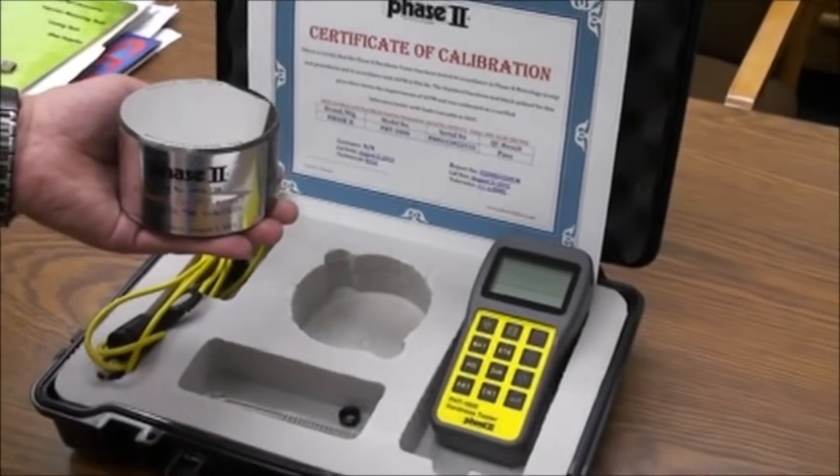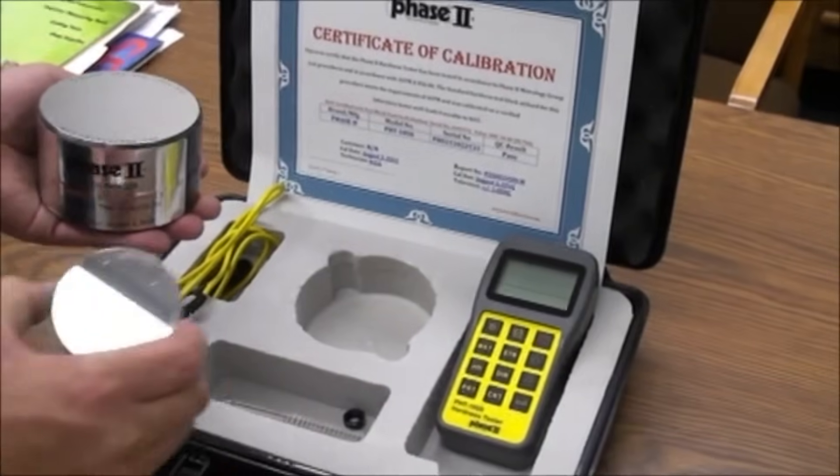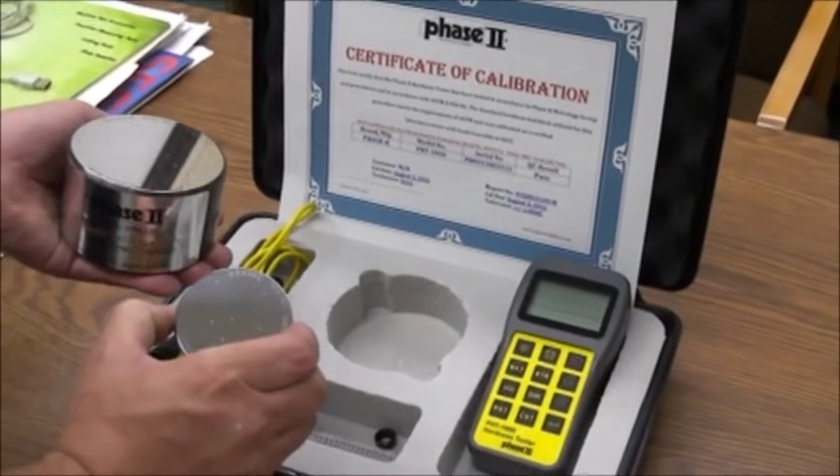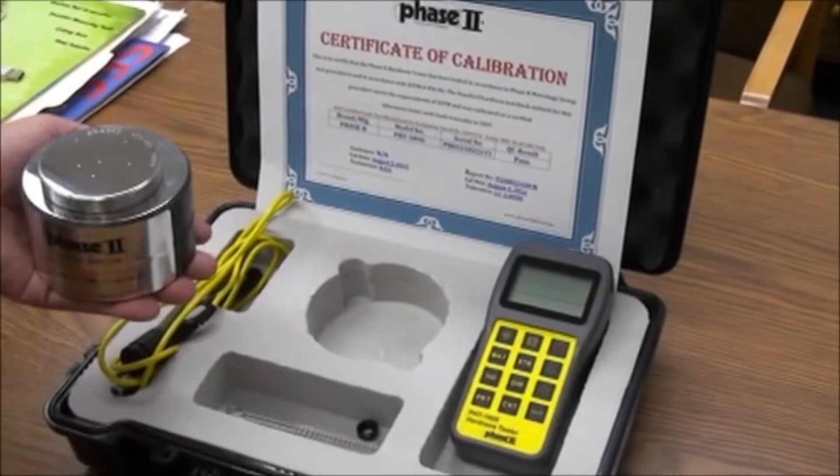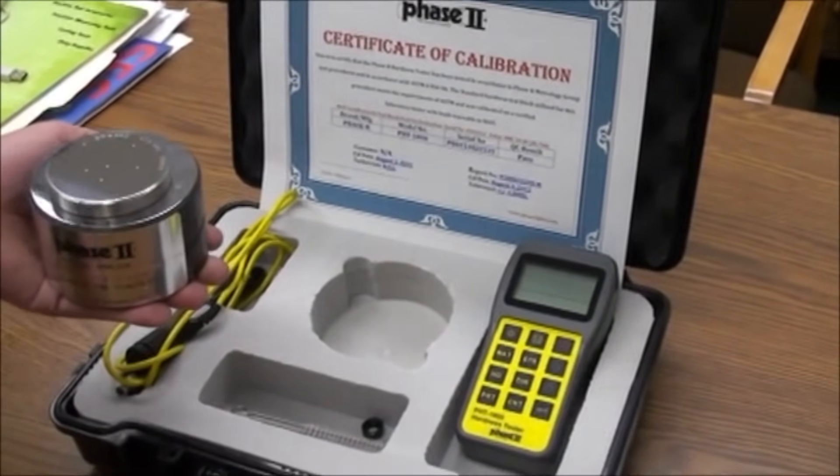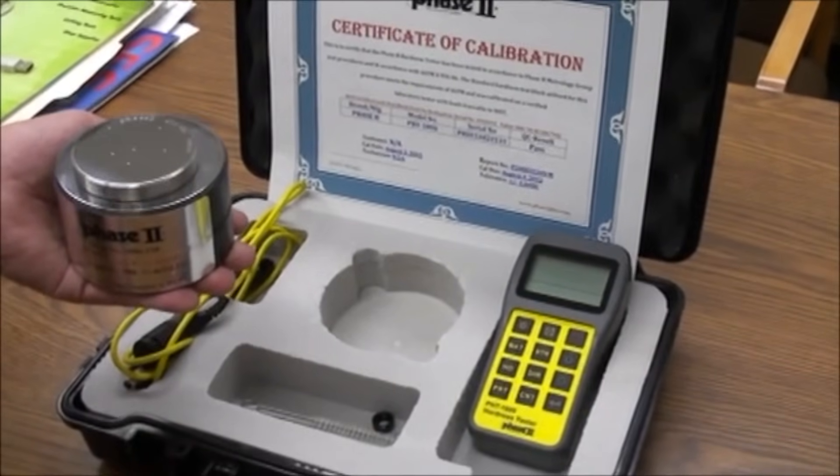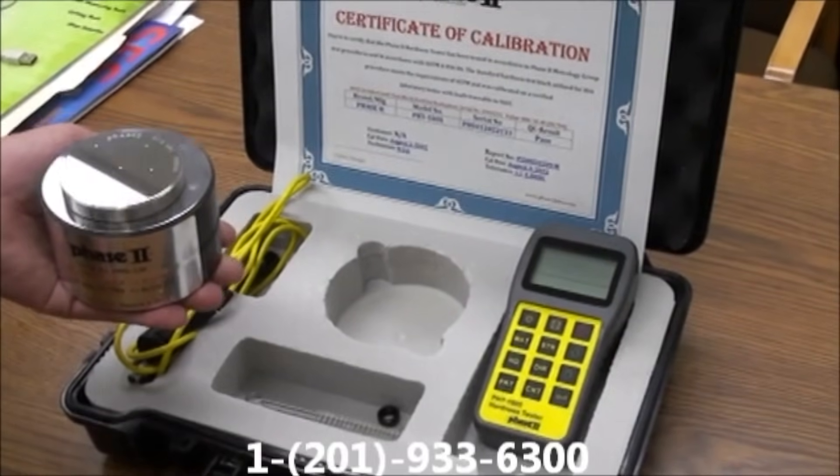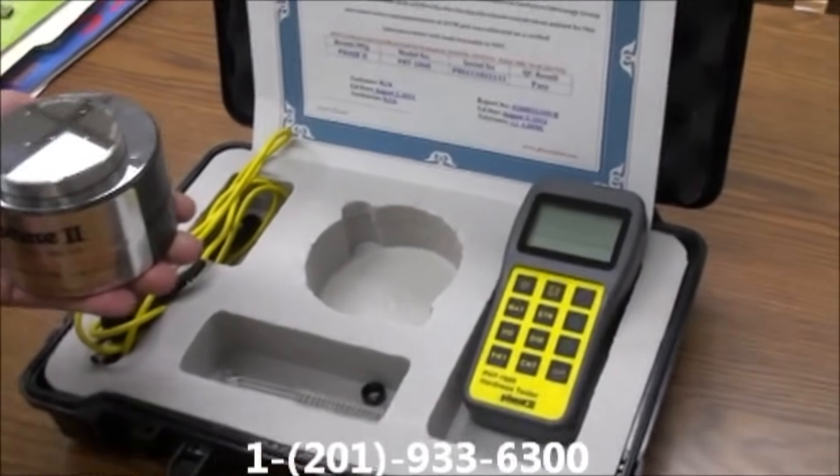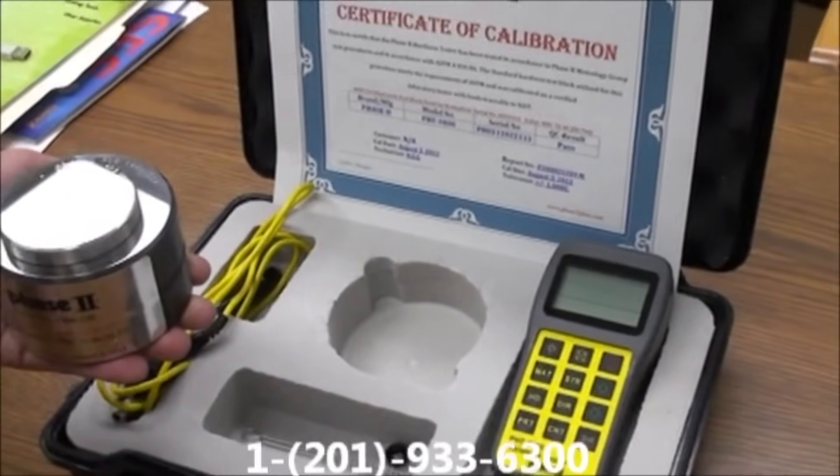Parts with mass a little less can be affixed, if possible, to something of larger mass to obtain performance. Should you have workpieces that are not close to such mass, please contact Phase 2 and inquire about our ultrasonic portable hardness testers.